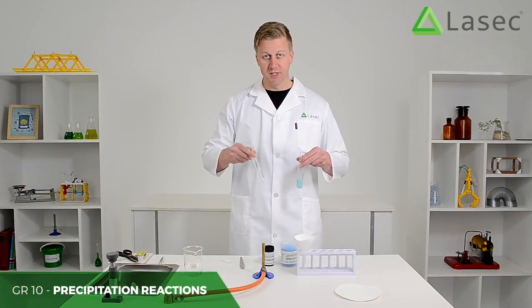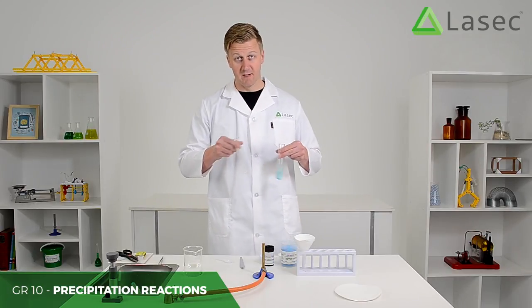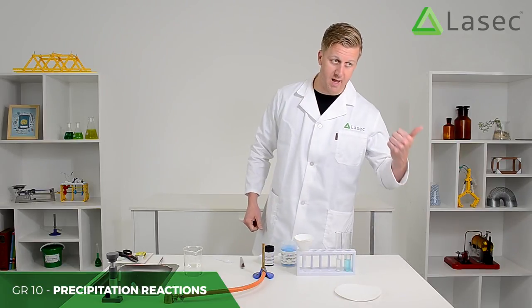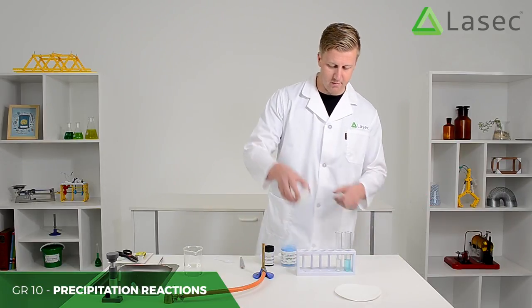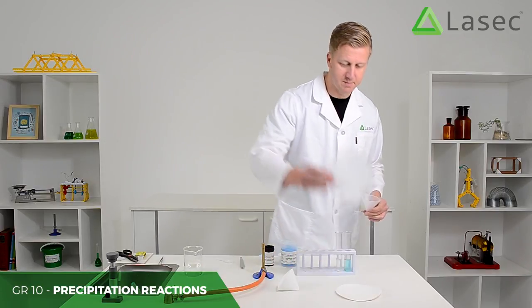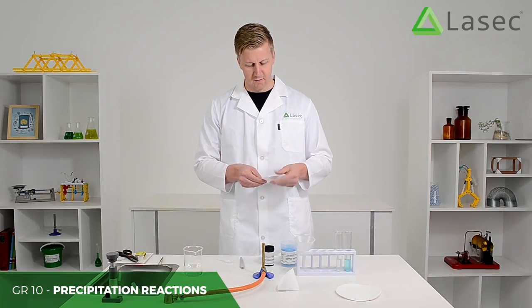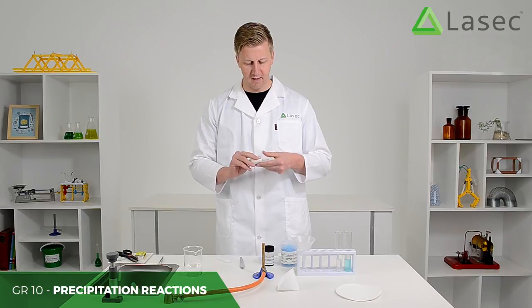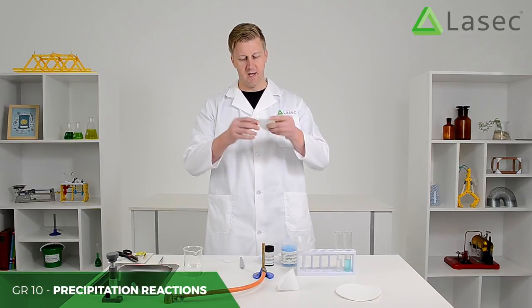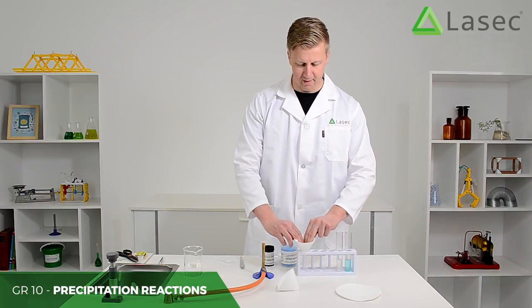So we have two solutions here and what we're going to do is pour both of them through a filter funnel with filter paper in it, and we will get a precipitate and then we'll get a solution. Here's the filter funnel — I'll show you how to fold one of these. You take a piece of filter paper like this, fold it in half, then fold it again into a quarter, and put that into the filter funnel like this.